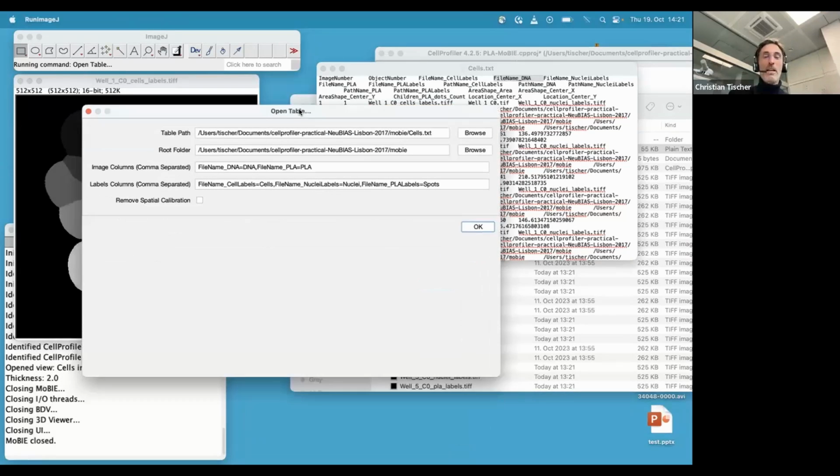So, okay, let's quickly discuss this. It's important. So actually where the table is doesn't matter. Oh, sorry. Oops, I'm not sharing. Oh, I'm sharing. Okay, I just went back to this menu, Maria, because that will help. So the table can be anywhere.